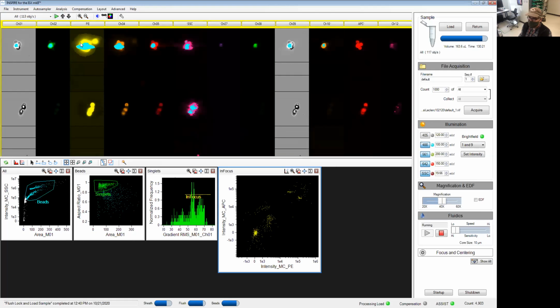Whenever you get these cyan dots on your images, that's simply a measure of the signal being too bright for your detector. It's saturating it, or the camera, I should say. So it's saturating the channel, so you get these dots. Same thing on the side scatter. So this is something you want to avoid as much as possible.